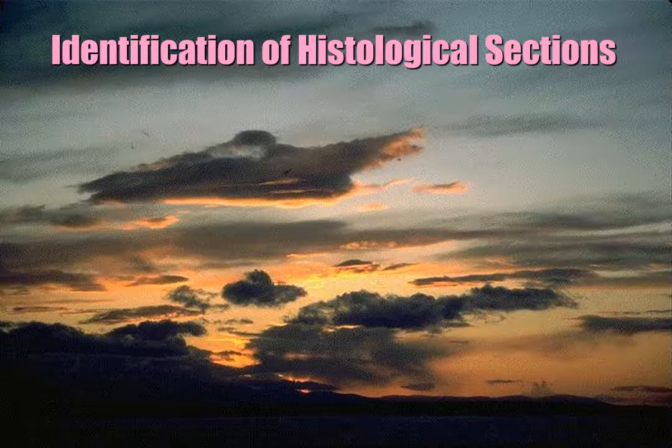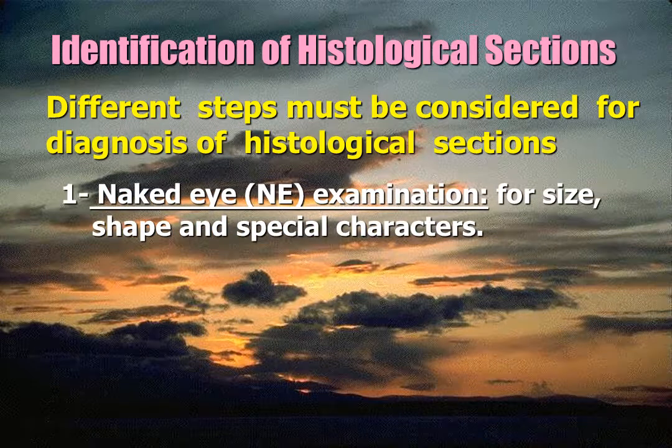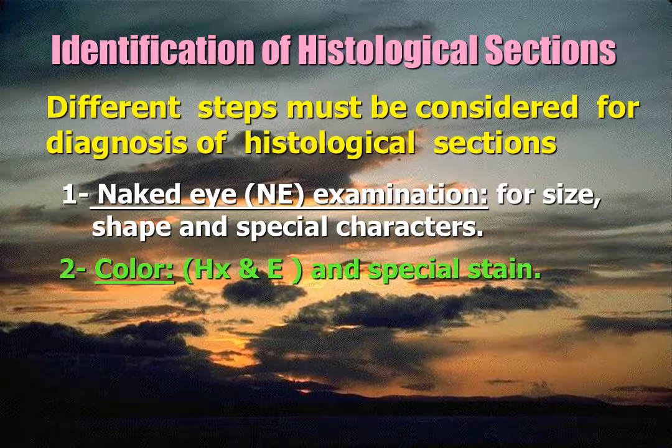Identification of histological sections. Different steps must be considered for diagnosis of histological sections. These are naked eye examination, NE, for size, shape, and special characters, and color, whether the section is stained in the usual stain, hematoxylin and eosin, or if there is any other special stain.